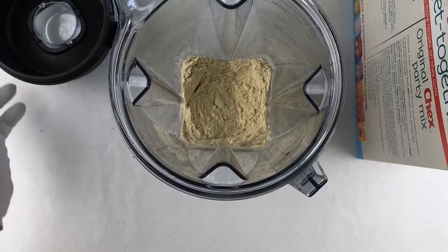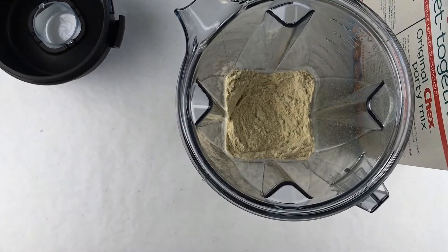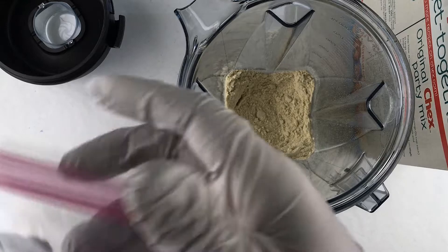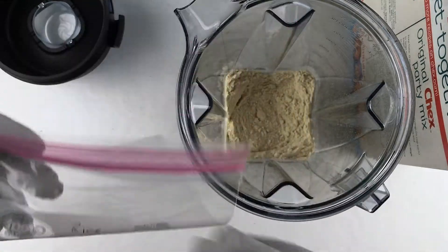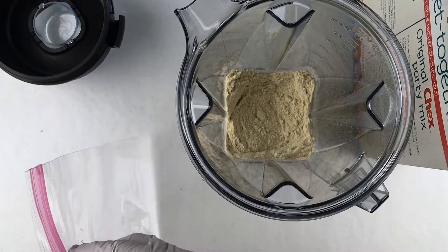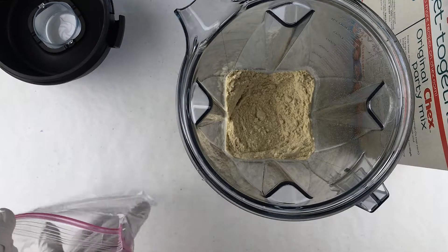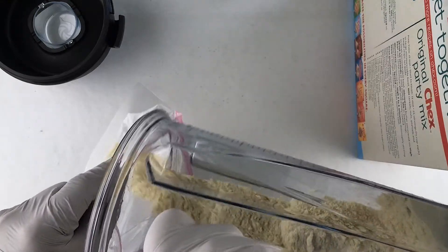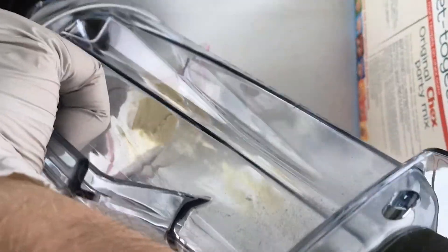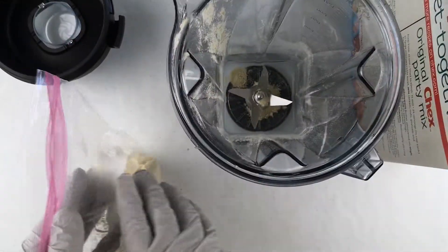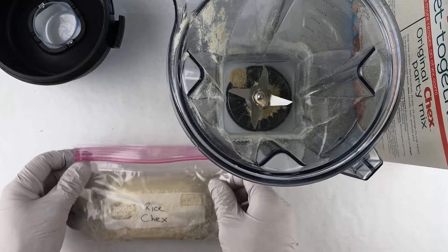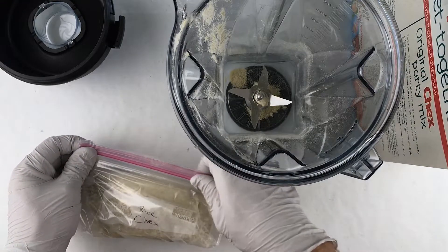Okay, there we go and I've got a bag here labeled Rice Chex. I'm going to pour it into this bag. Okay, so there we've got our Rice Chex sample.